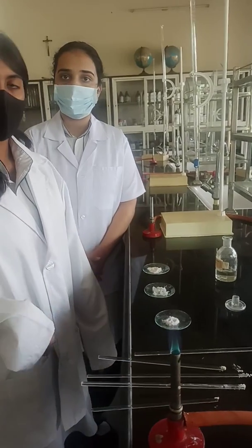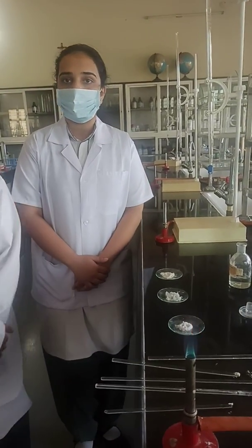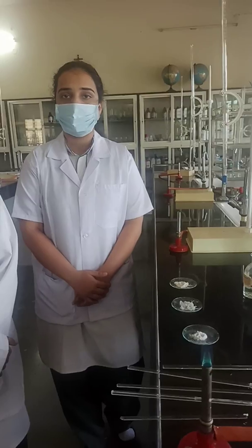So a very wonderful observation you have seen. Barium gives apple green or grassy green colour. Strontium gives crimson red. And calcium gives brick red. Very good. Thank you so much.